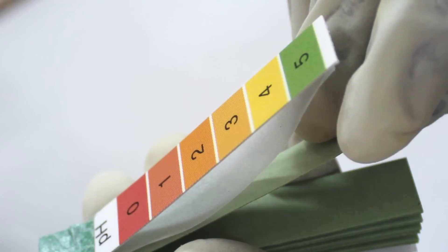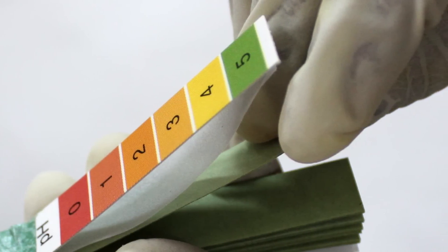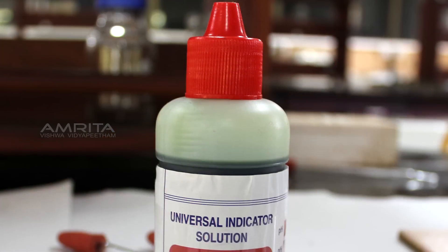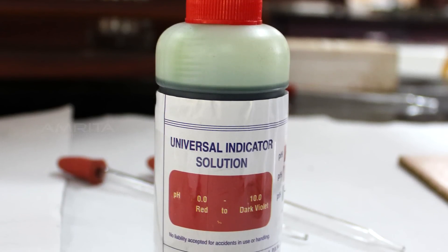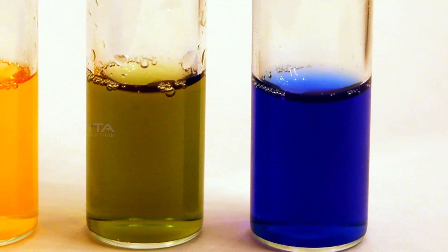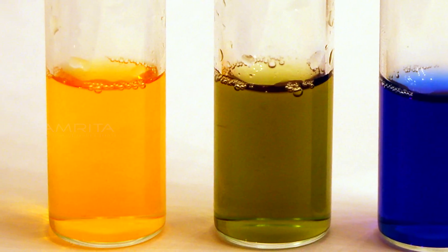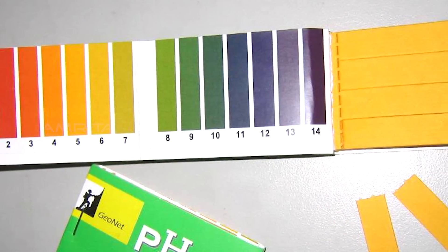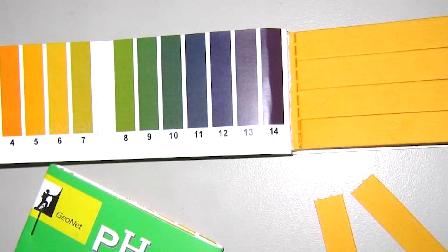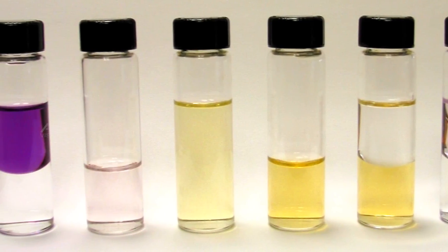The pH value of a solution can be determined using a pH paper or universal indicator solution that have a broad range of indicators exhibiting several smooth colour changes over a very wide range of pH values. Our aim here is to find the pH of given samples using pH paper and universal indicator solution.